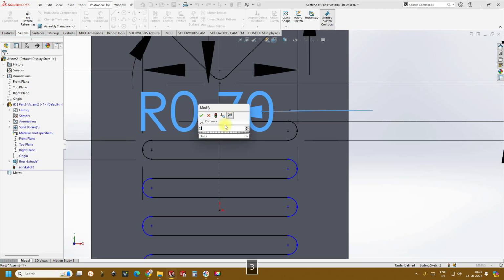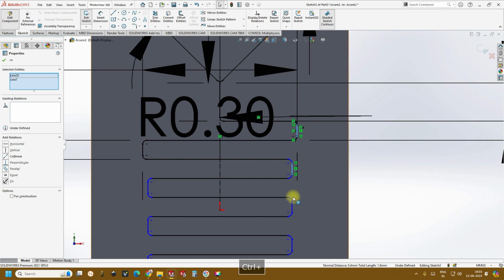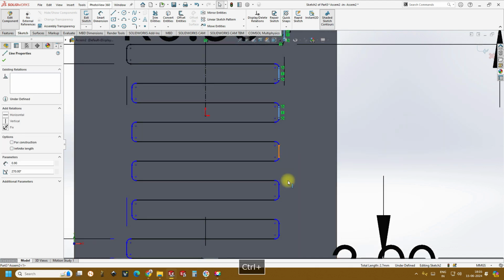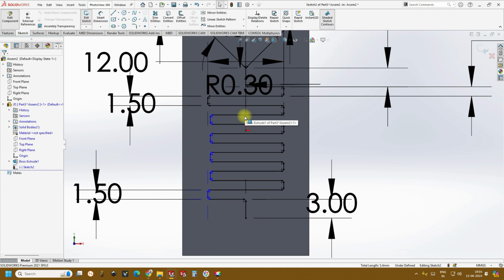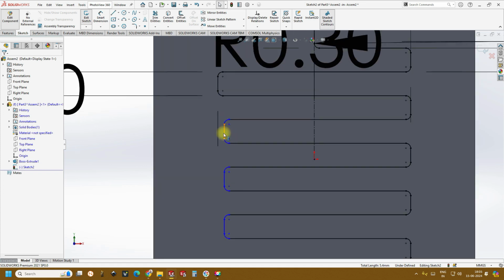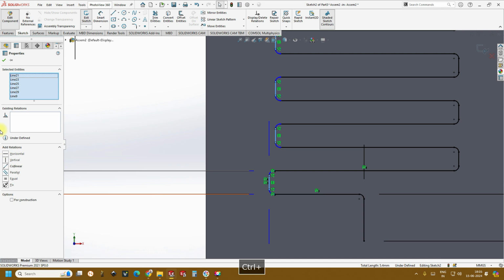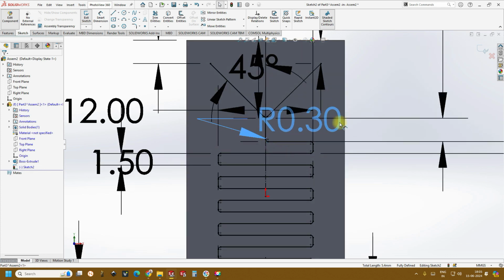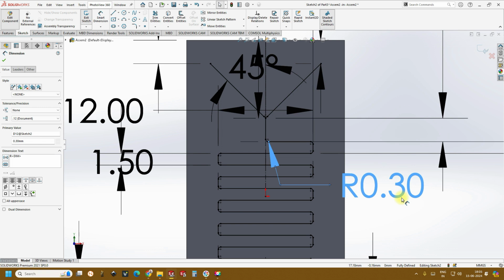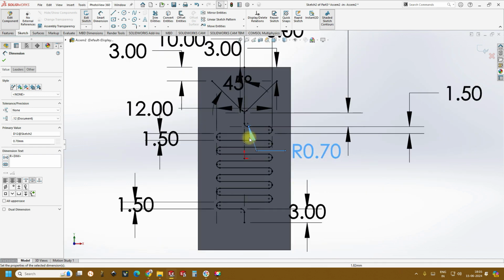So now let's change this to just 0.3, just an easy way. And now click line. And now click on the collinear. And I will tell you why I have reduced it to 0.3. So previously we couldn't see the collinear symbol because when clicking, sometimes we might miss the order of selection. So now we can change this directly to 0.7. Okay, now if you see, the selection was easy and changing the dimension was really easy.